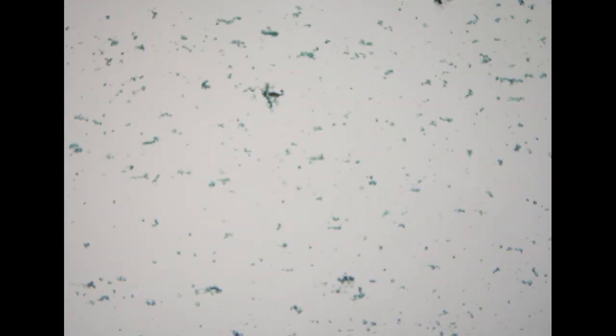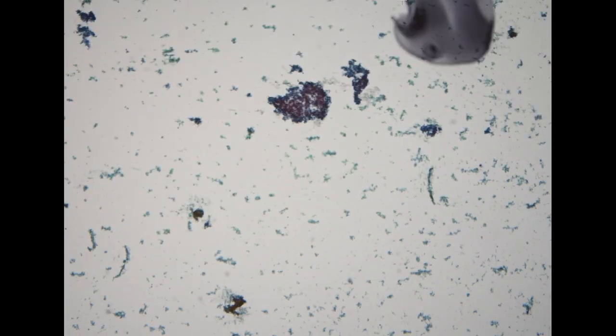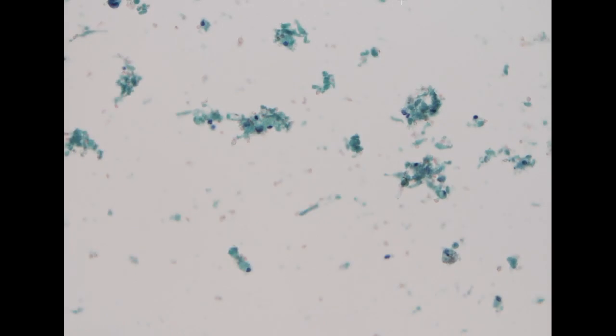So let's move to the fine needle aspiration. This is an aspiration from the breast. The clinician aspirated a cystic lesion, and we received a liquid specimen with 7.5 milliliters of bloody liquid. So we performed a cytospin preparation. In this preparation, you see in the background quite a bit of granular, perhaps necrotic, background.